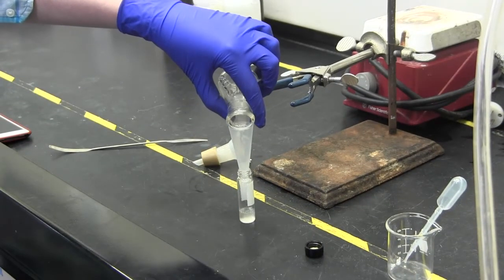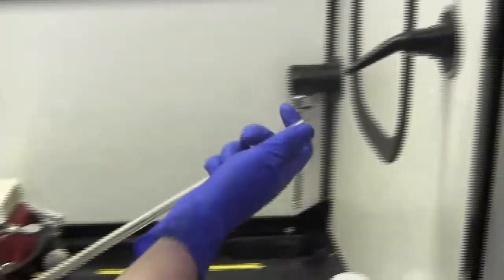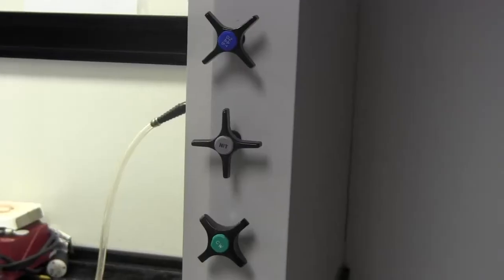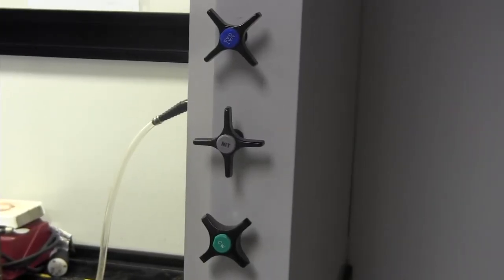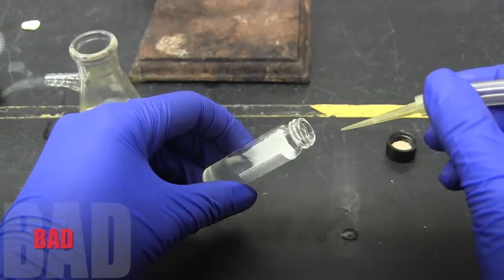Dry the filtrate with nitrogen. To dry with nitrogen, attach a small teflon tube to the bottom spigot on the inside of the hood. Then, use the gray knob to control the pressure of the nitrogen. It is best to keep the pressure very low, so you do not blow the sample out of its vial.